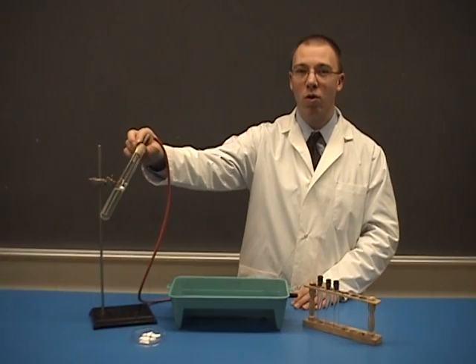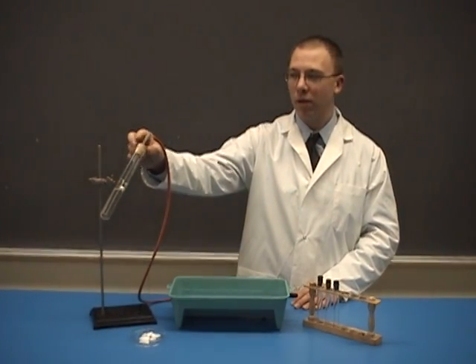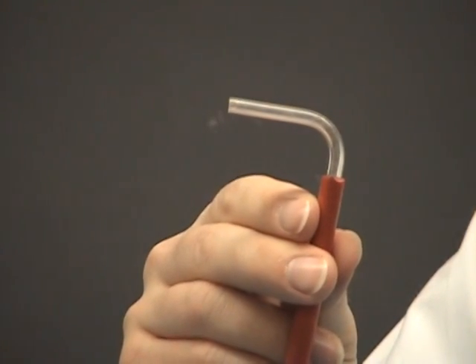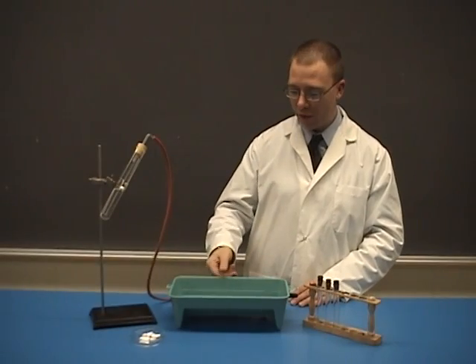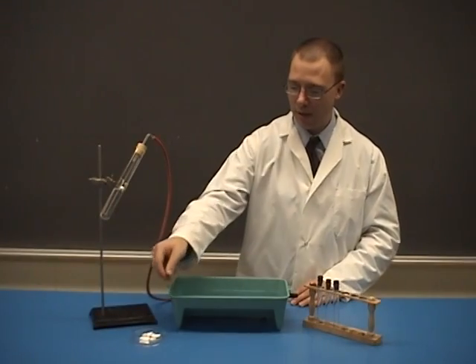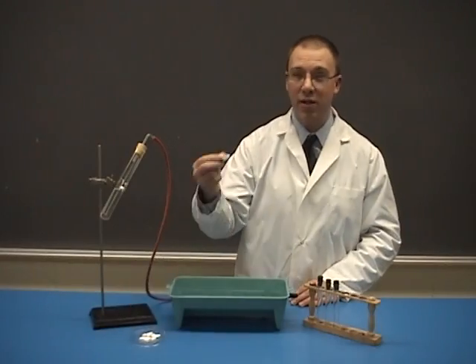A one-hole rubber stopper, surgical tubing, and a glass elbow, a trough to collect the gas already filled with water, and half an Alka-Seltzer tablet.